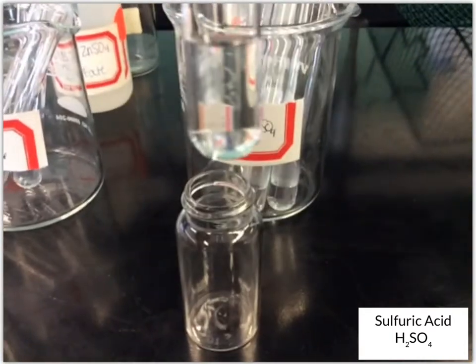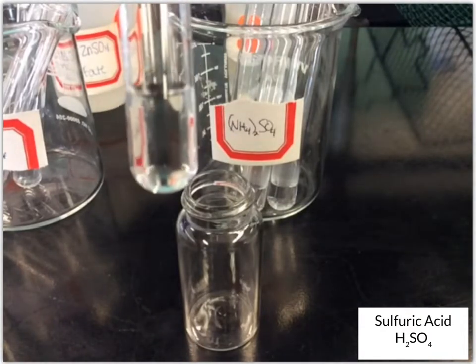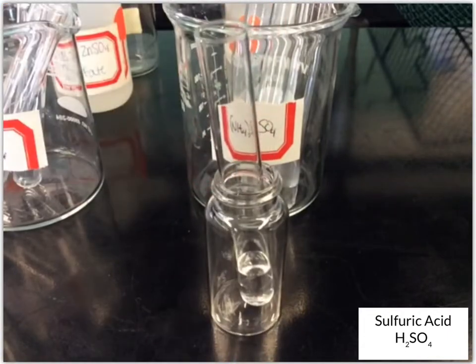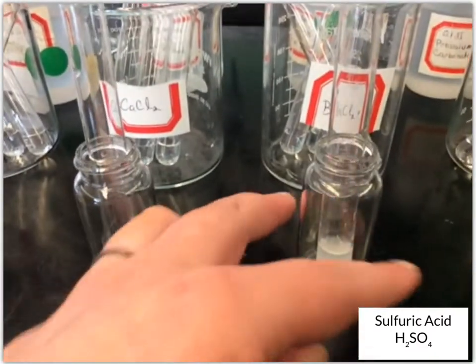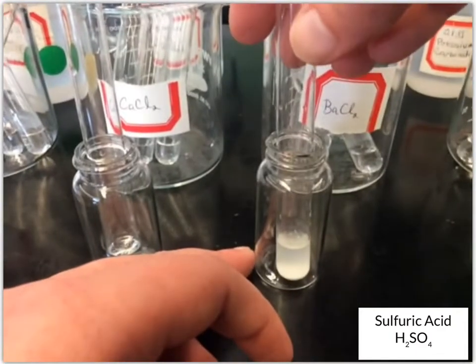Okay, and we still have a clear colorless solution. And let's go back, because we had the barium chloride, right? This was our barium chloride. And remember, it was that white solution.